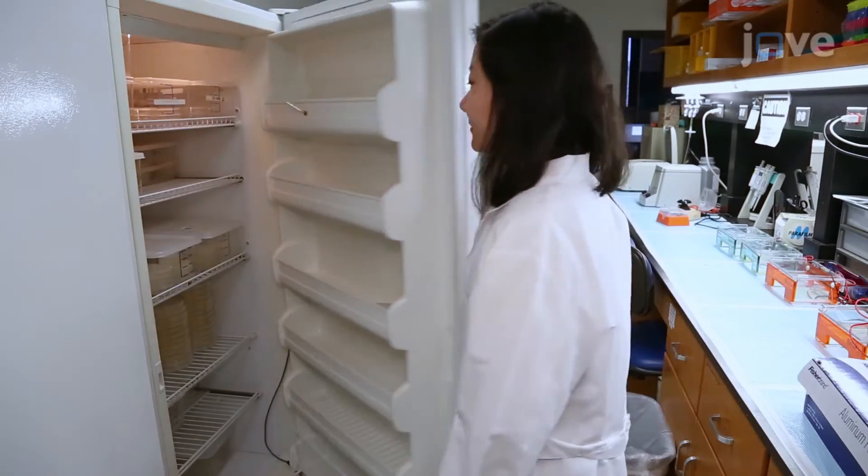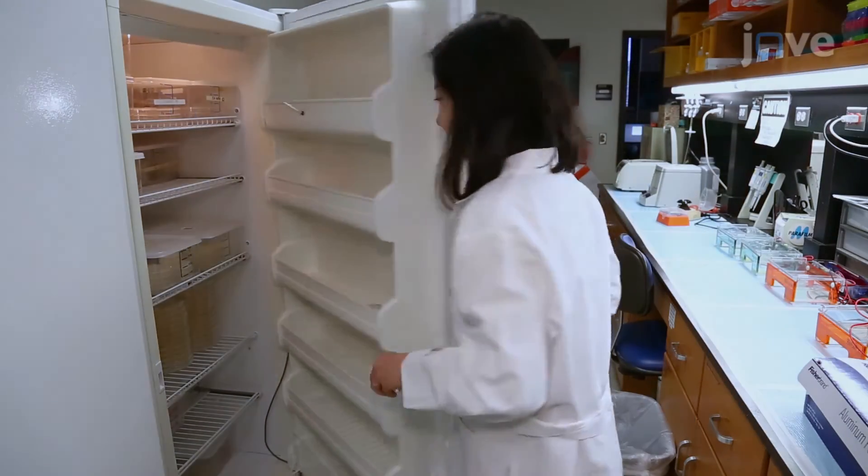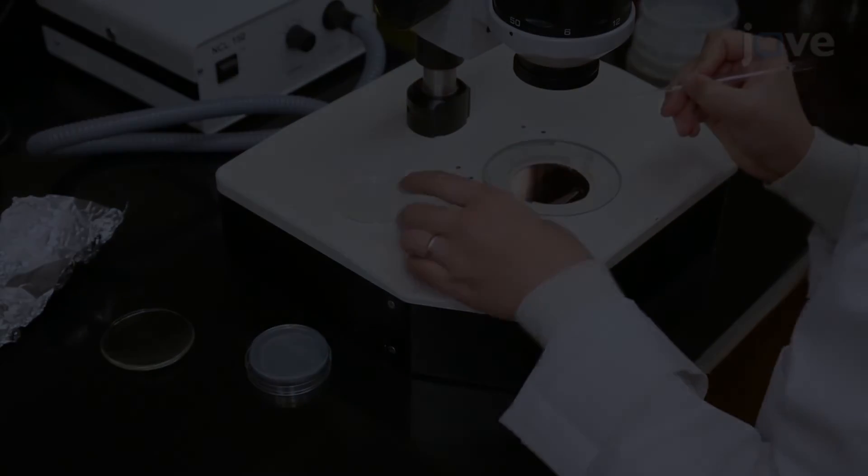On the second day, transfer the stained males onto a new seeded NGM plate to clean off excess mitodye stain.